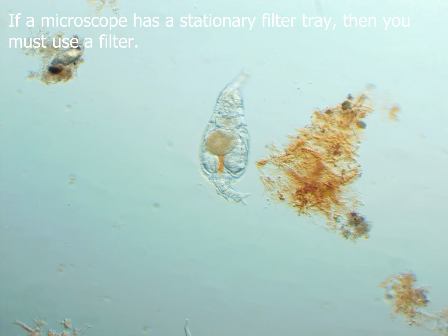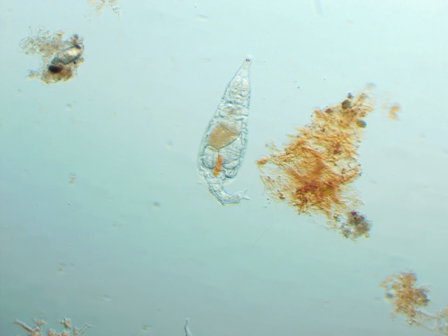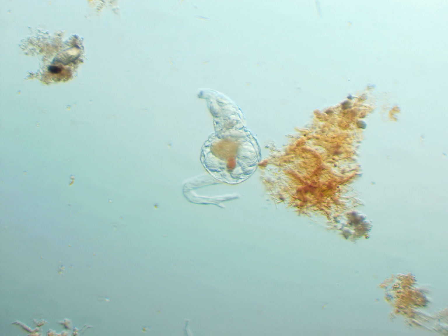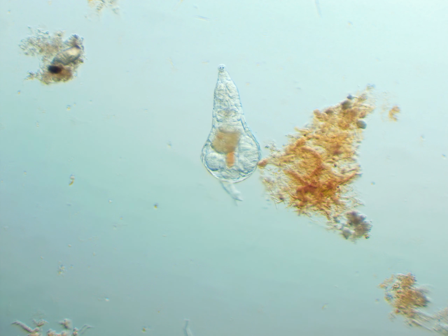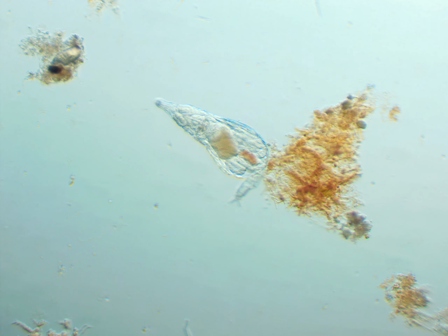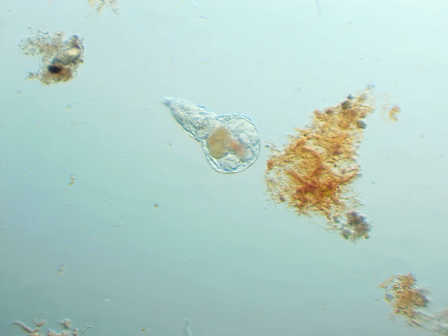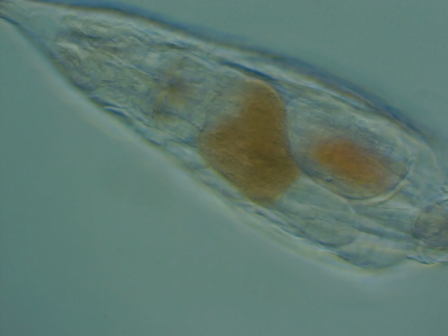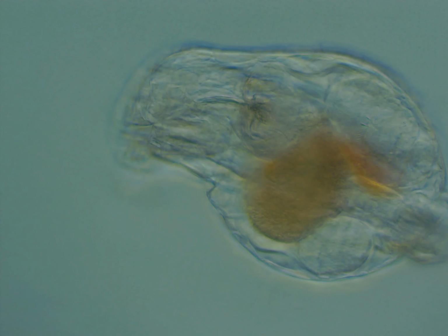But it allows you to see the three-dimensional aspects of these bdelloids a lot better. You can see its insides in this three-dimensional space, and you can see its tail going under its body a lot better with these shadows. I've done oblique illumination before, but I've never done it in an actual video on my YouTube channel. But here you can see it with the 40 times objective in oblique illumination.